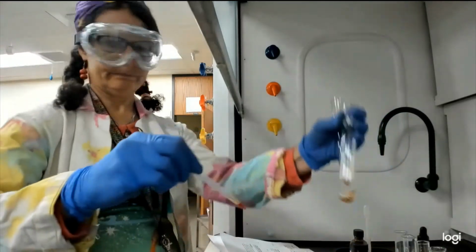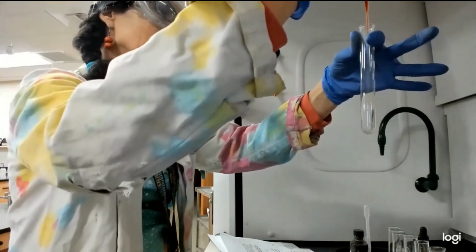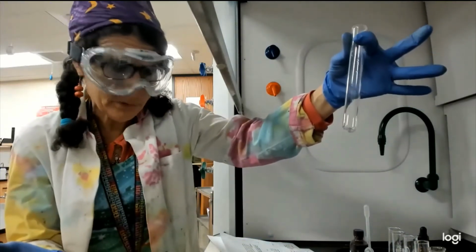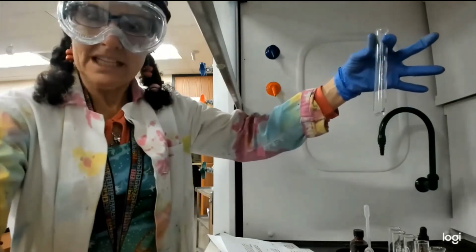Okay, this is cool. That one, nothing happened. You guys see? Yeah, I guess I did add the bromine. Immediately. That's the thing that's really cool about chemical reactions. They happen so freaking fast. It's like, as soon as the bromine touched it, it was gone. Okay, we're going to pause.